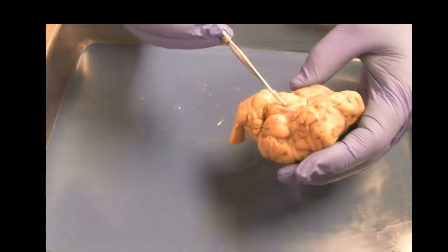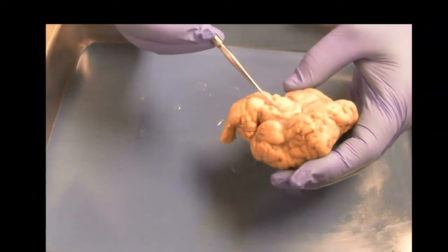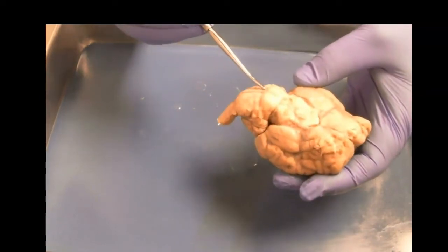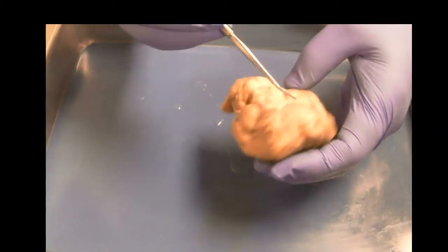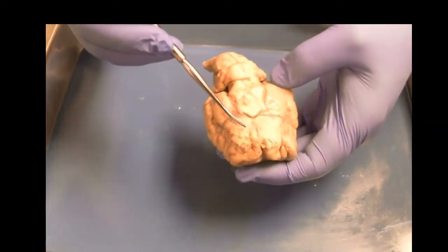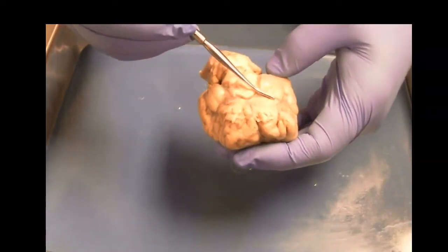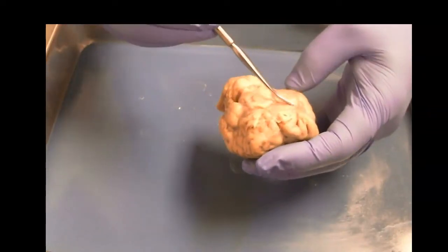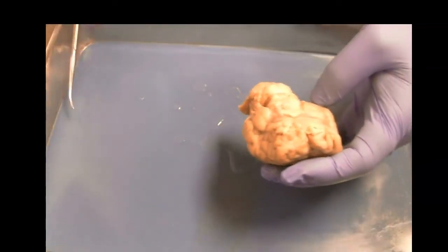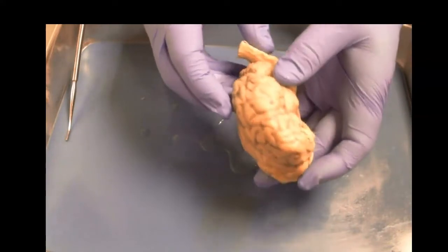A lot of the nerves are very small and difficult to see. We see little remnants of nerves, cranial nerves. The largest one here is the olfactory. We can see this one fairly well. That's this here. And this connects, we know, directly to the limbic system.